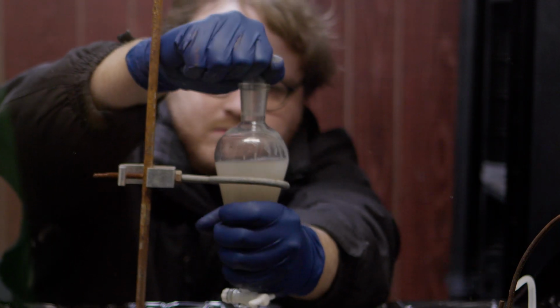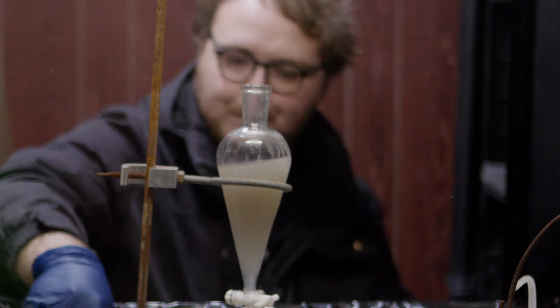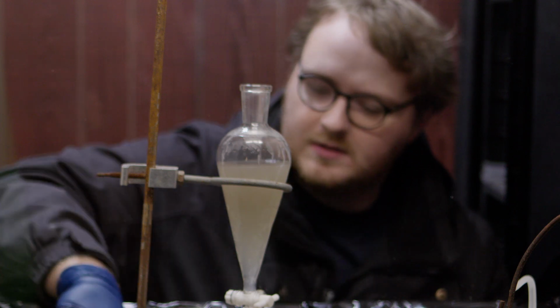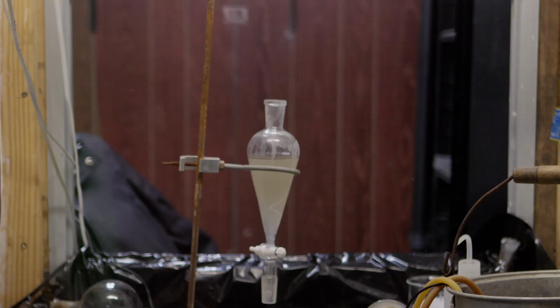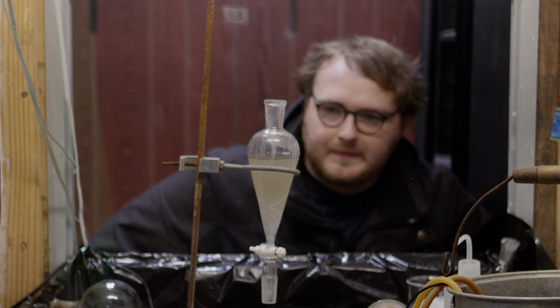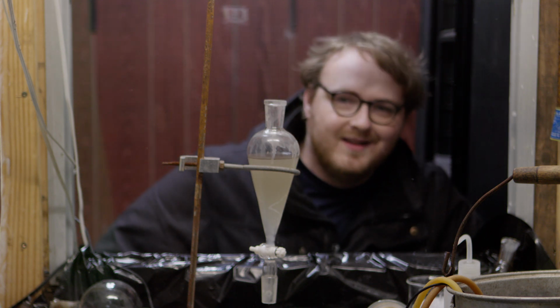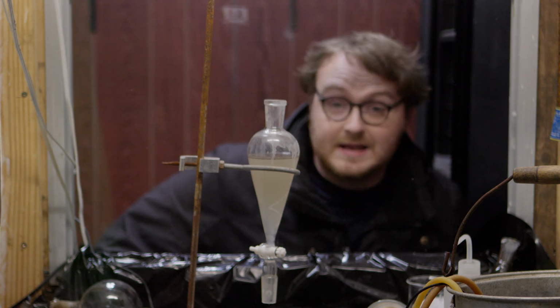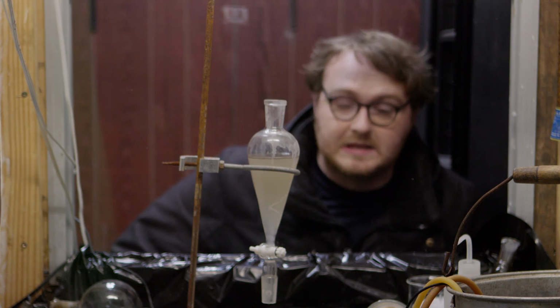So now we play a waiting game. I'm going to wait 6 or so hours for it to improve, and if it doesn't improve by much, we're going to have to resort to different methods. Okay, that's awful. Okay, so clearly that didn't work. We left it for several hours and that did nothing. I guess the next resort is we have to go completely cursed.